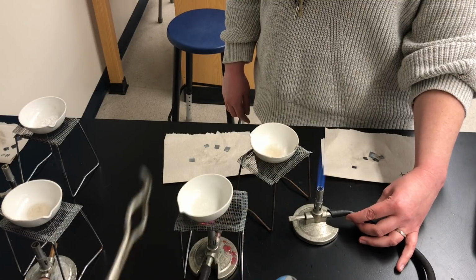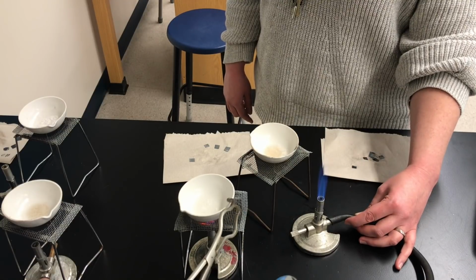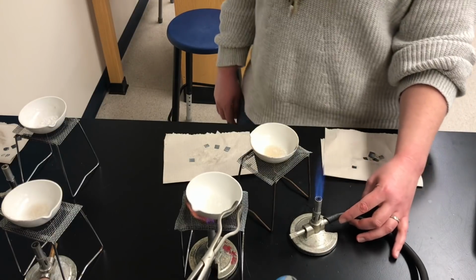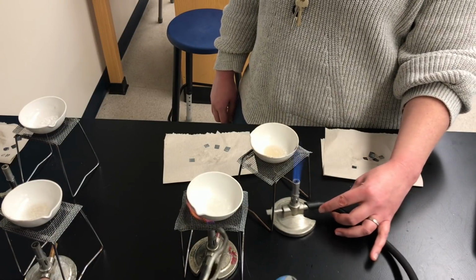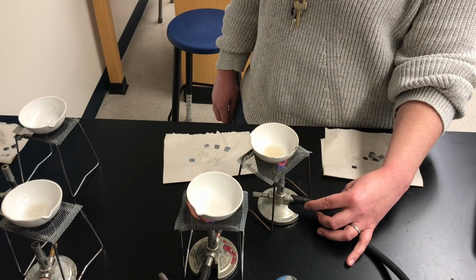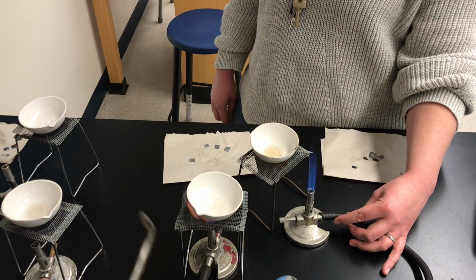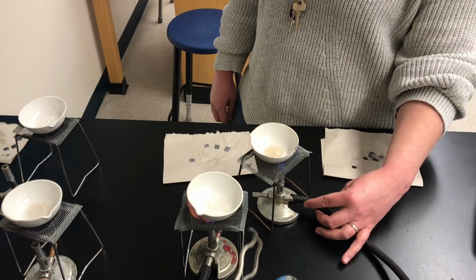Okay. I think that one's probably done, Ms. Watts. Zinc chloride has a relatively low melting point, so as we heat, when the water is finished evaporating, the zinc chloride would actually melt. So during the heating, you'll start to see it turn white crusty, and hopefully you'll see some of that here. That's the zinc chloride salt. But then as we continue heating, that white crusty zinc chloride salt will begin to melt. So what happens is it goes from looking wet when there's lots of water to looking drier and drier when there's less and less water. And then it actually starts looking wet again because the zinc chloride is beginning to melt.